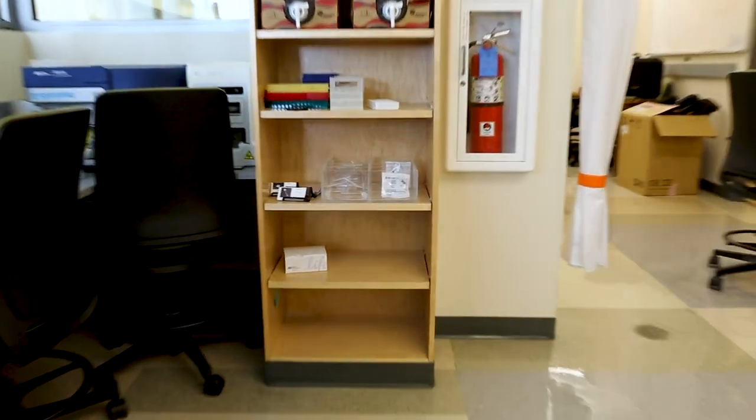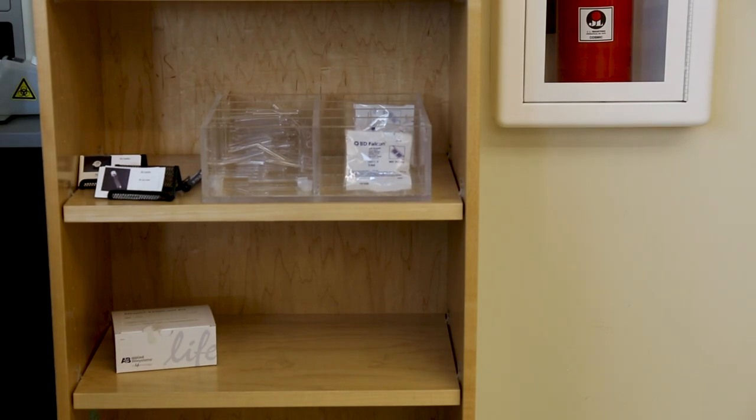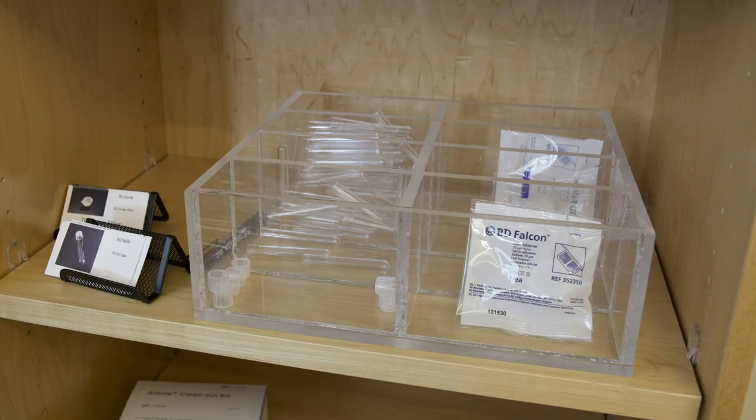We highly recommend using the 70 micrometer mesh filter or cell strainer for all samples before running. Your professor can buy cell strainers or nylon mesh fabric. We keep some strainers on hand for sale on the rack, but we only want to be a backup if you run out.